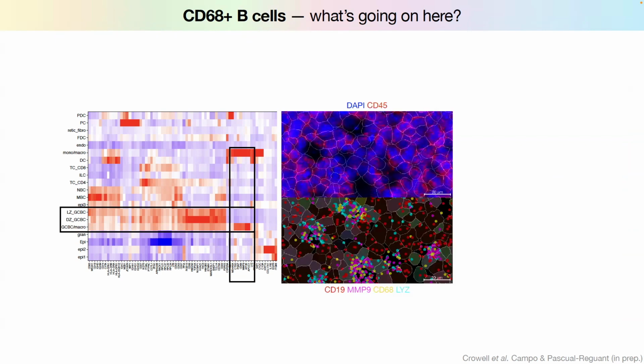And if you look in space, what you see is that here's blue, DAPI, those are cells, and CD45, which is marking immune cells. And we have these black holes. And there's a bunch of CD19 everywhere because those are B cells. And then there's all of these macrophage genes that are in the black holes. So that's weird. Now it makes a lot of sense, but the first time I saw it, it was weird.